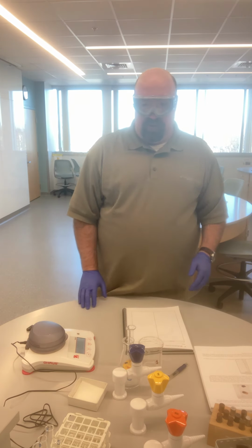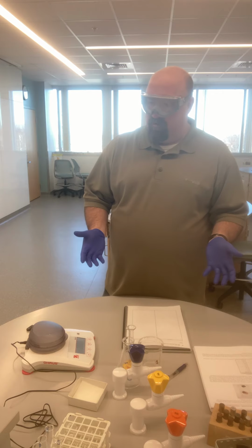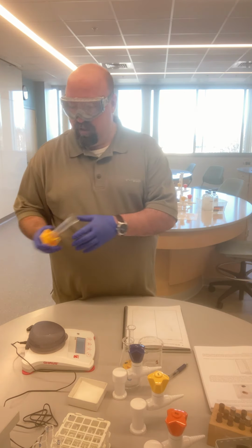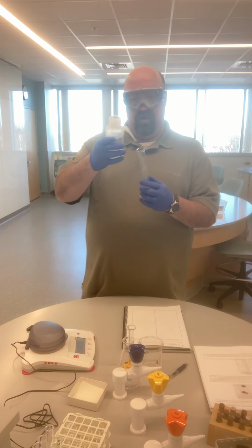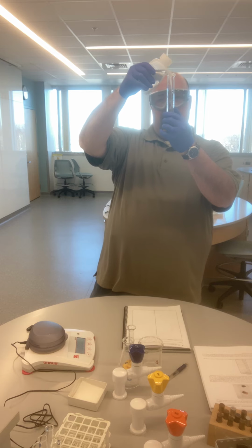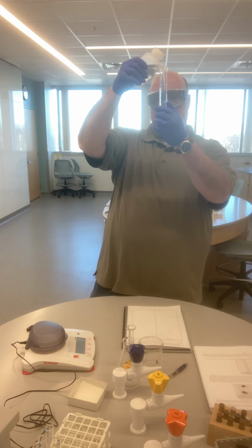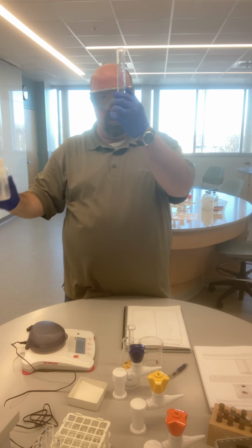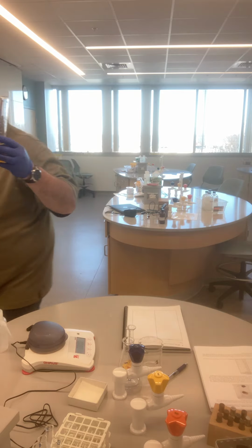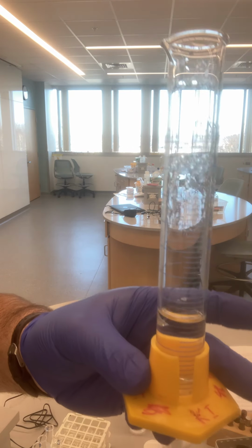And so let's just sort of look at the way that we do some of these measurements, or the way that we measure some things in a science lab. Let's first take a look at something that happens within a graduated cylinder. And so this doesn't necessarily happen as much in a beaker, just because the width of a beaker is so much greater. You can see a picture of this as well on page 4 in your manual, but I just want to give you an idea in real time, so to speak.